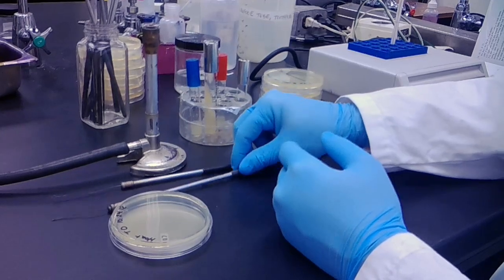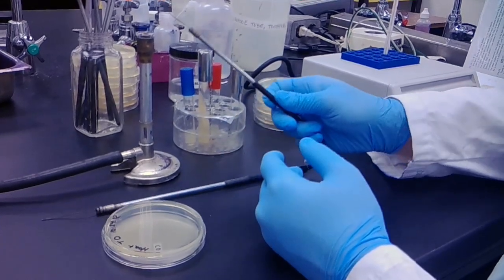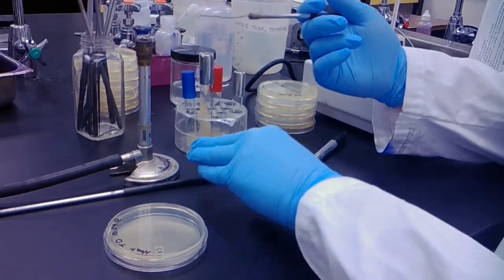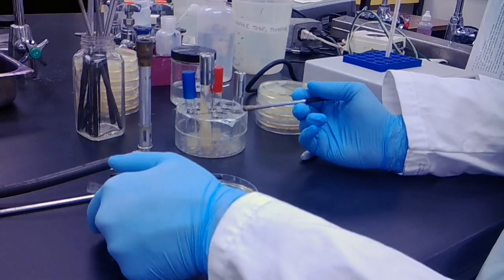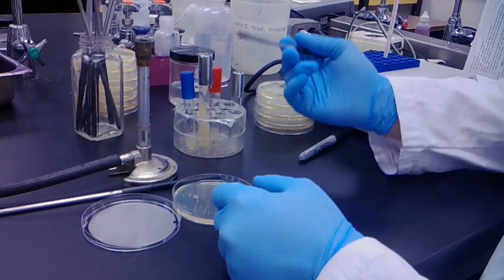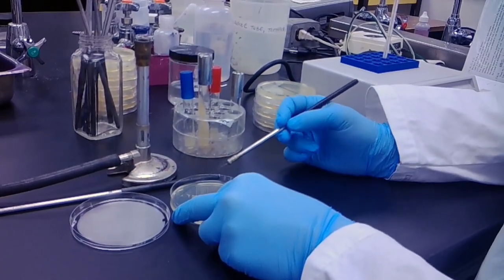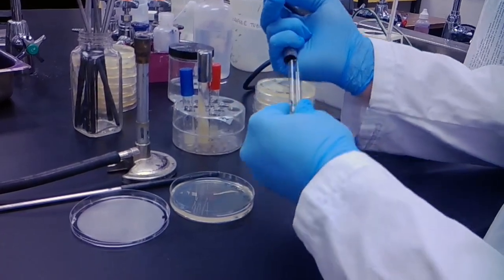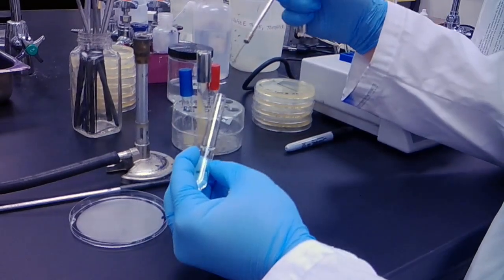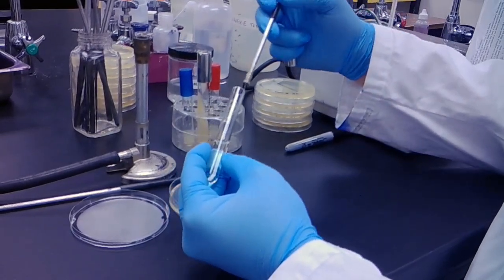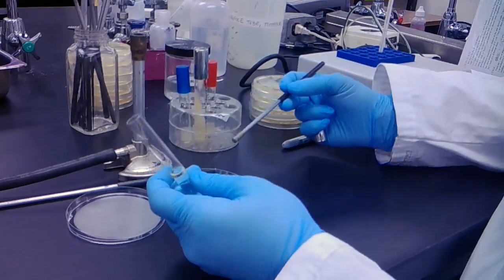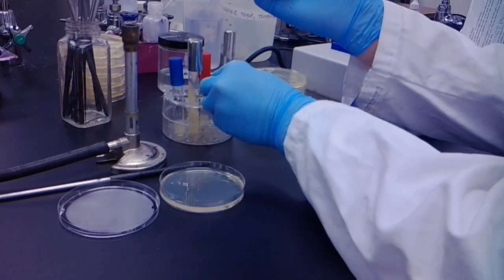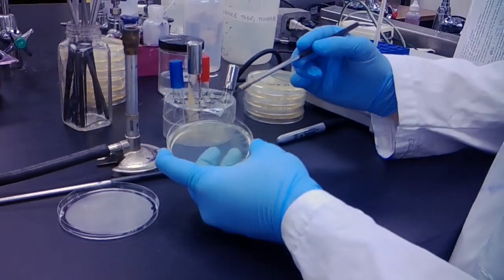I'm going to take one of my loops, flame sterilize. Again, aseptic technique, working inside your flame. Now I'm going to spread.